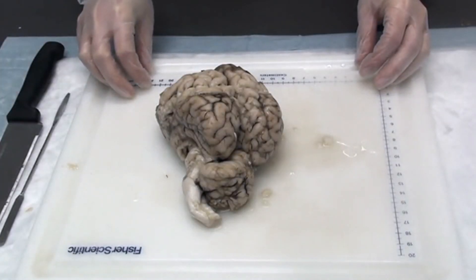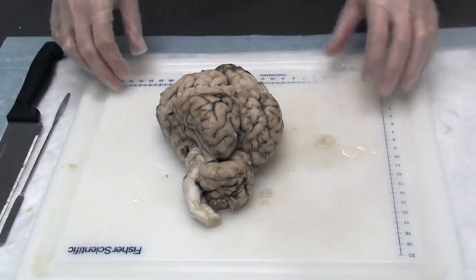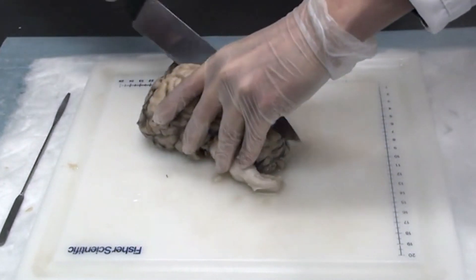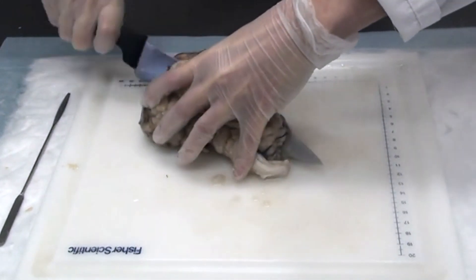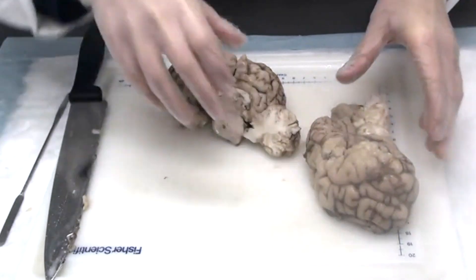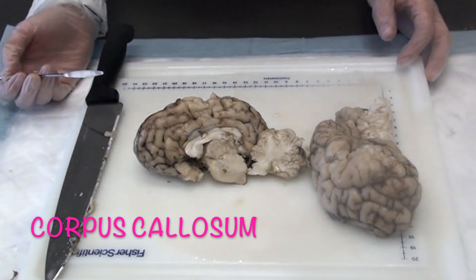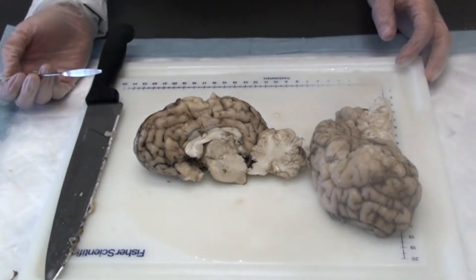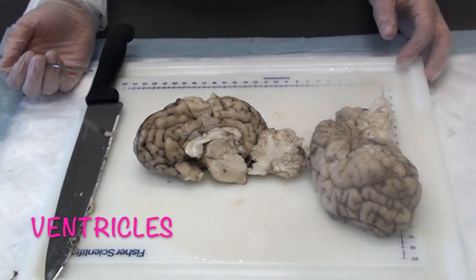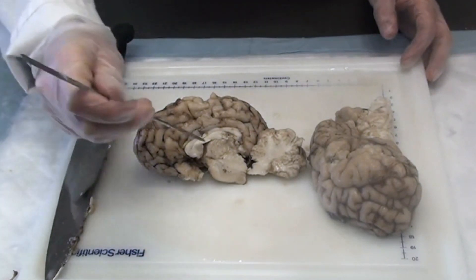Now it's time to take a look at the inside of the brain. We're going to very carefully cut the brain into two halves right down the middle. The part right here is called the corpus callosum — it is a thick bundle of nerve fibers connecting the two cerebral hemispheres. The empty spaces here are called ventricles. They're normally filled with cerebrospinal fluid too. CSF is made in the ventricles, and there are four ventricles — we can see two in this view.